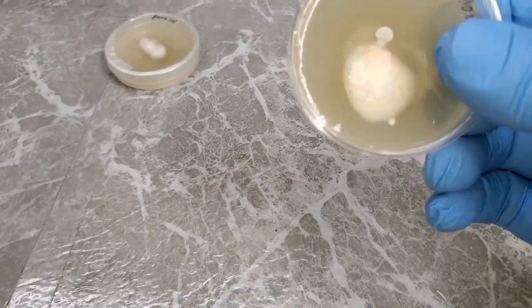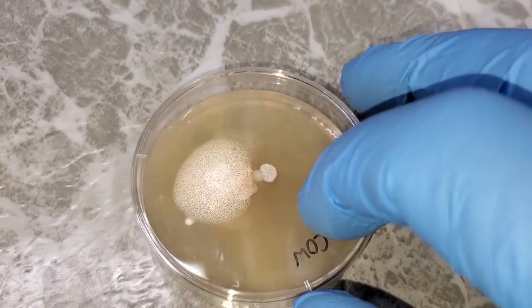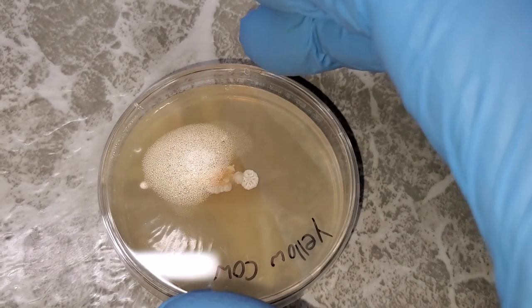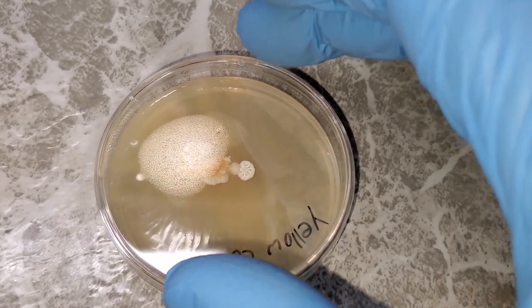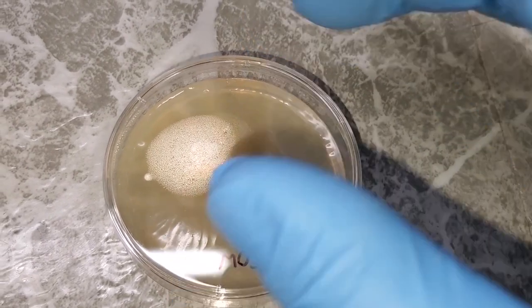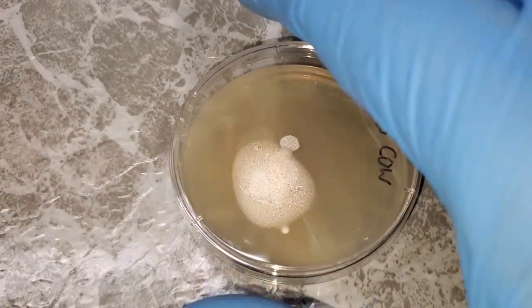Yeah, let's go with this one right here, because I don't mind taking the lid off this one. If I have to lose this petri dish, it's not the end of the world. We're going to use this one as an example to look at underneath the microscope, and to talk about with the lid off. That way you can see it easier. Well, let's just get into it. So let me take the lid off here.